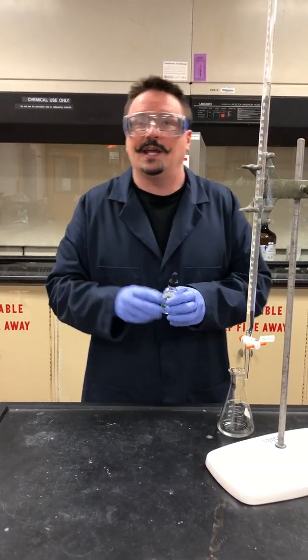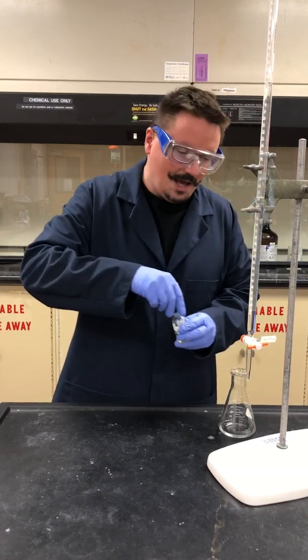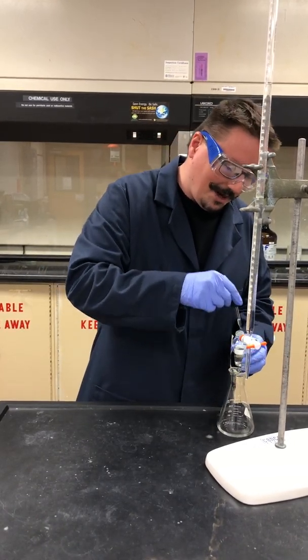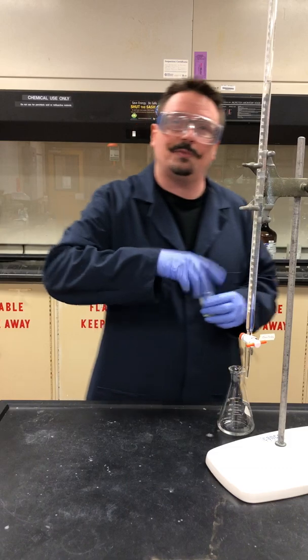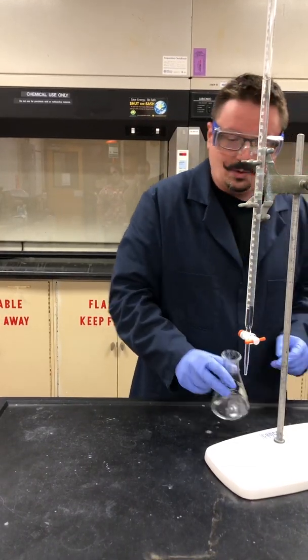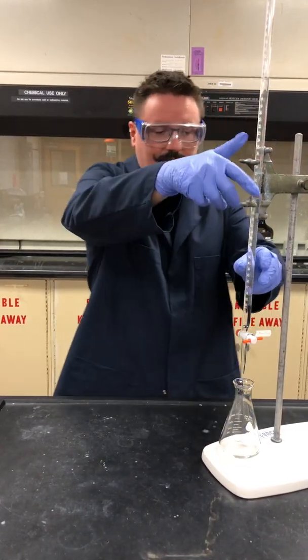We're going to use an indicator — in this case phenolphthalein — because it's going to change color at about the pH that we want, which is the equivalence point. So we're going to carry out this reaction.